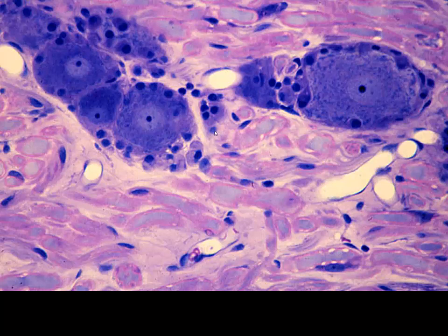We can see some of our myelinated axons that are going back and forth between. Almost looks like maybe a node of Ranvier. Those may be some Schmidt-Lantermann clefts, probably a node in that location. And a lot of the cells that we see surrounding these cell bodies are going to be what some call satellite cells. You see how they're circulating around these particular nerve cell bodies, but these are also Schwann cell nuclei. They're not myelinating the cell body, but remember, Schwann cells are going to support even unmyelinated fibers.